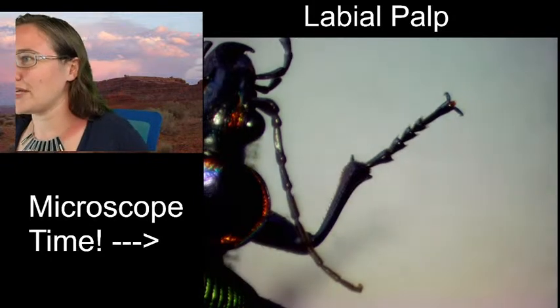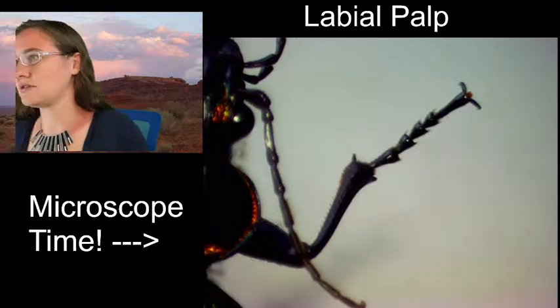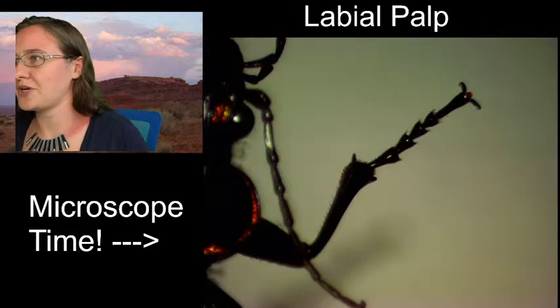Alrighty. Oh, my light got dark. I wonder if that will brighten it up. Nope.